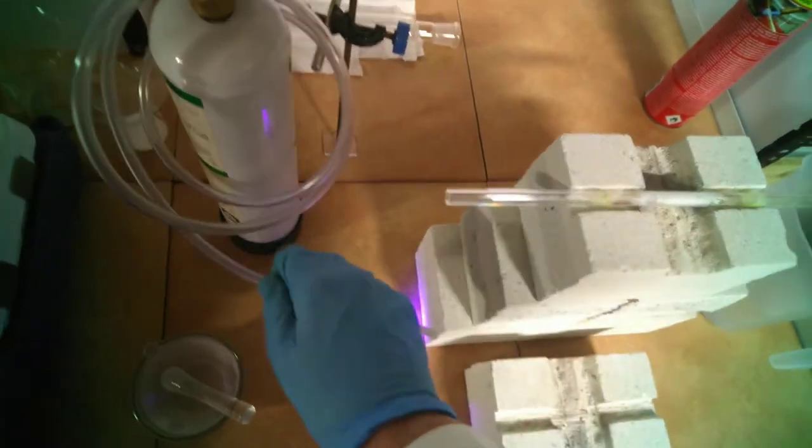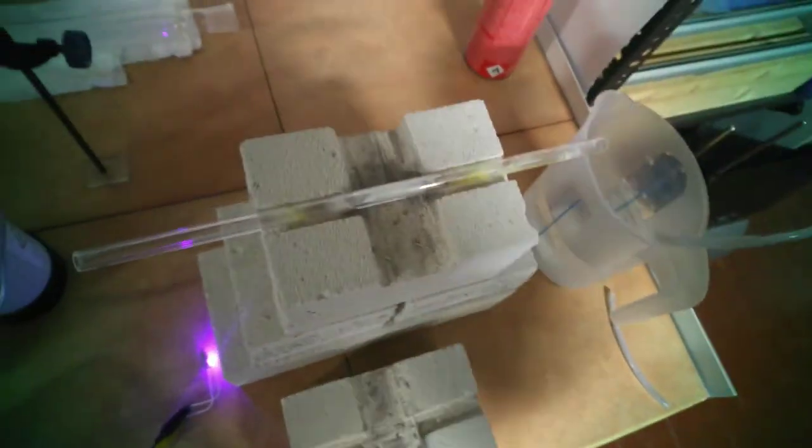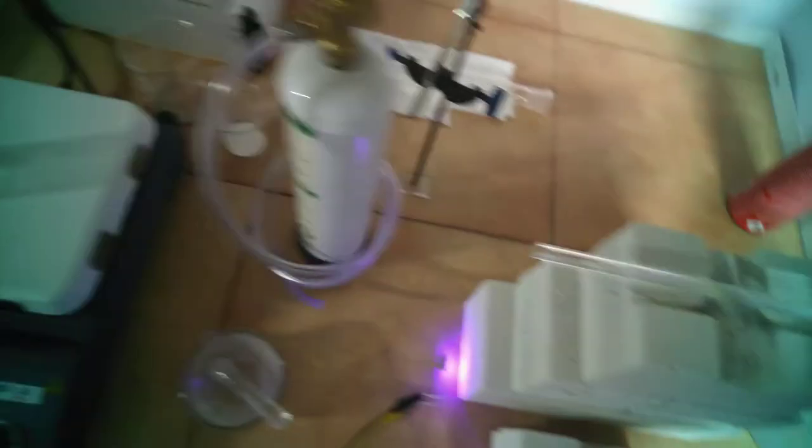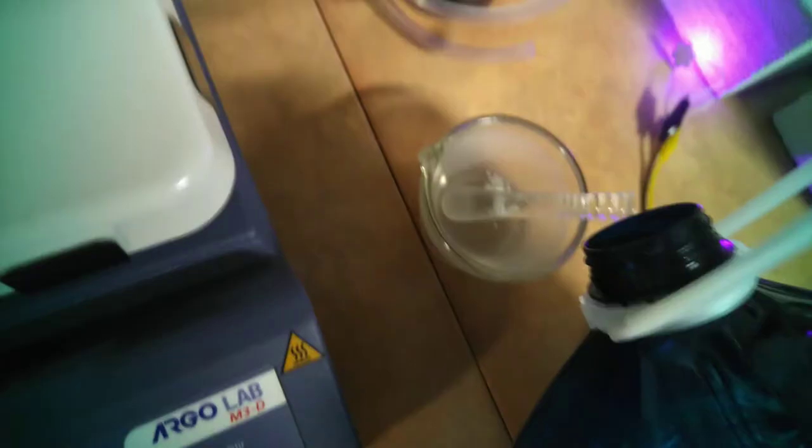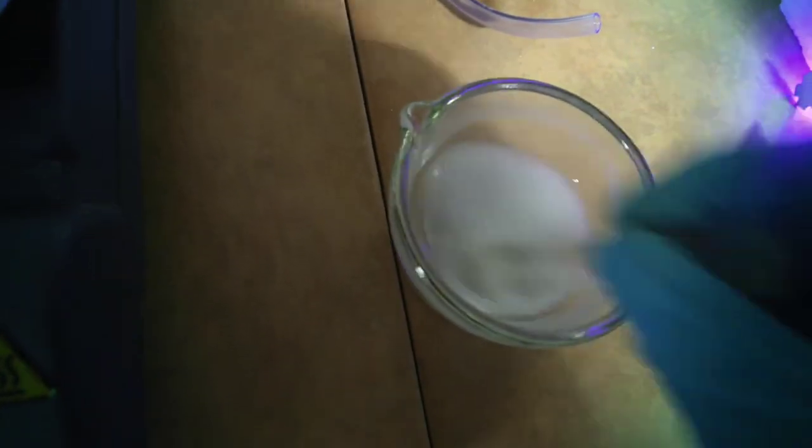After it is let cool, the phosphor is now ready and can be removed from the tube. It is suggested to wash it with water to remove residues and to powderize eventual clumps.